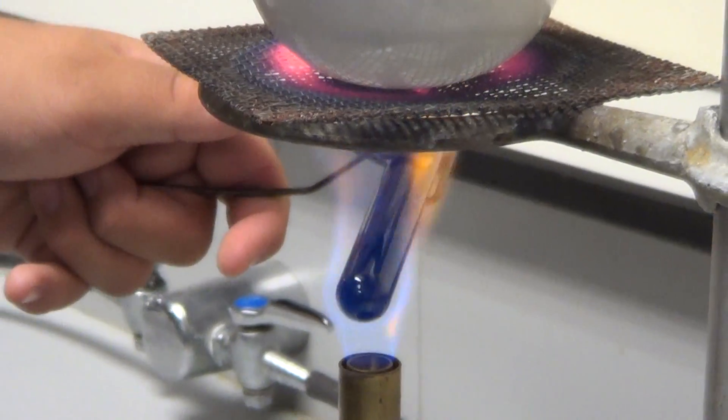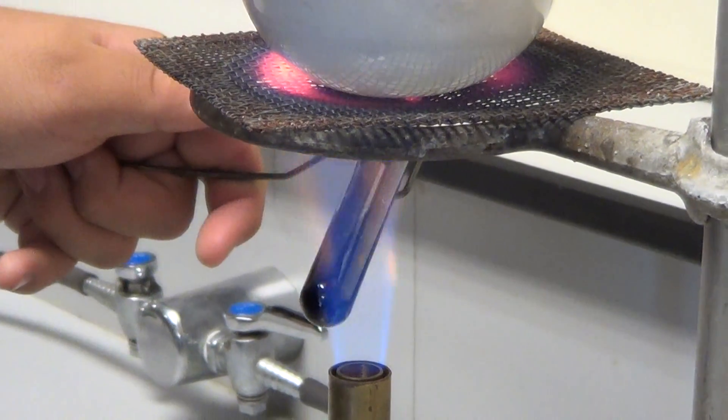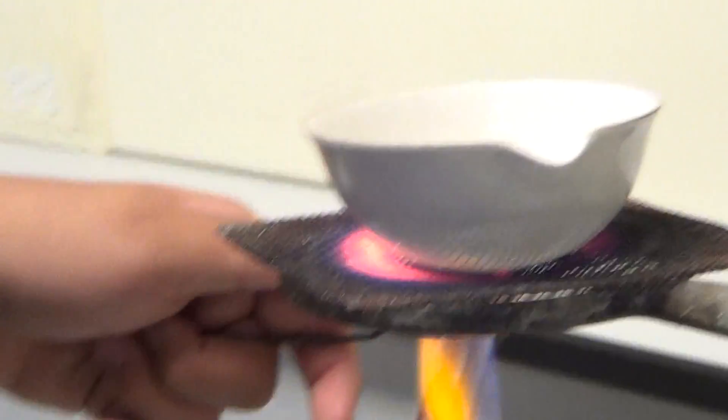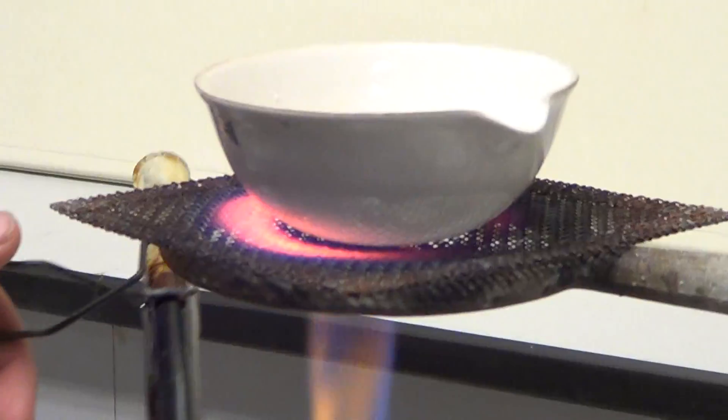Oh my god, the fire is like burning the side of the... It looks like it's burning. Oh no. Oh no. It's shooting up. Oh no.